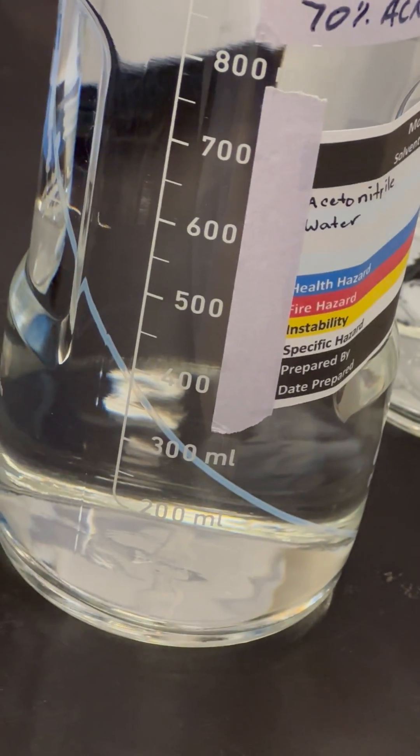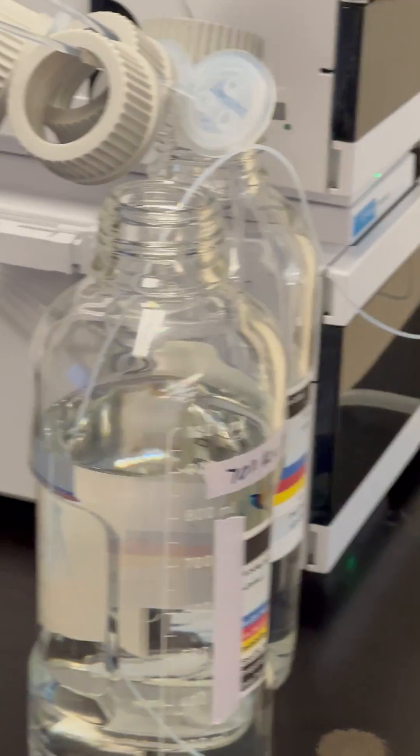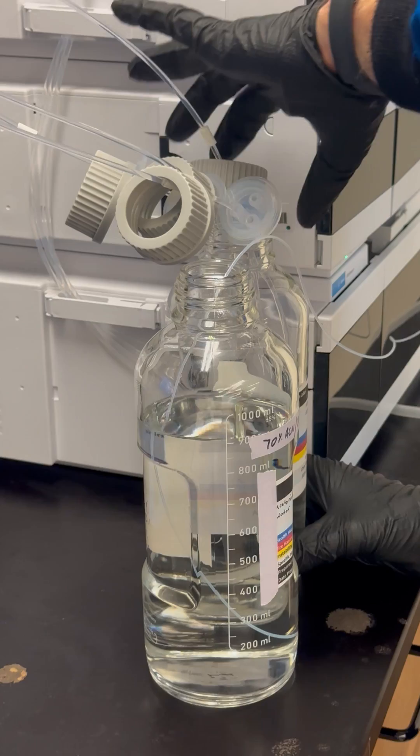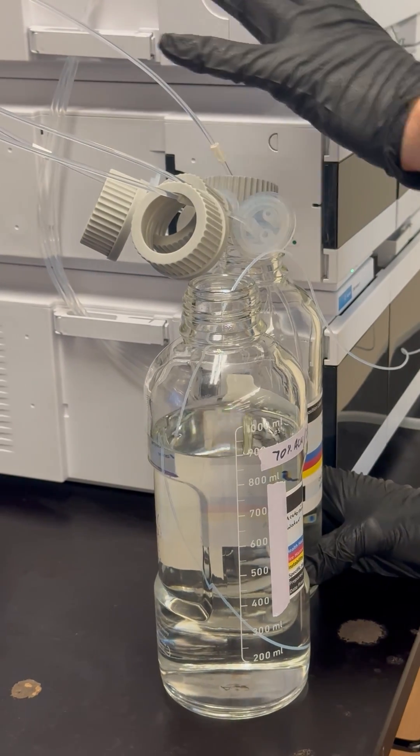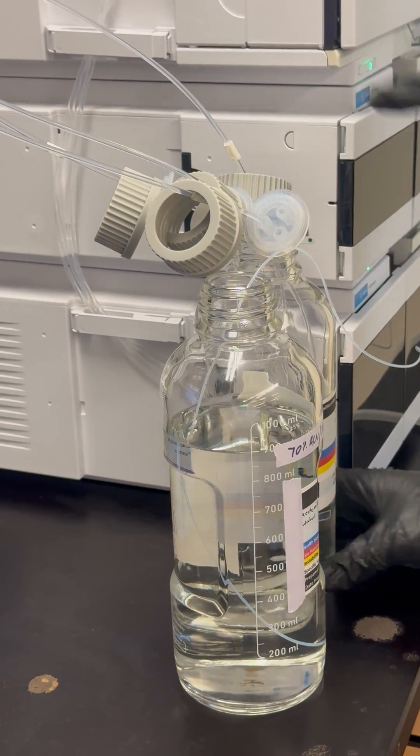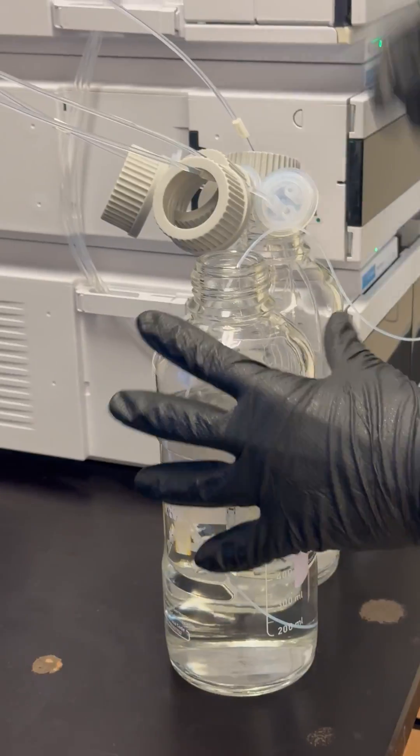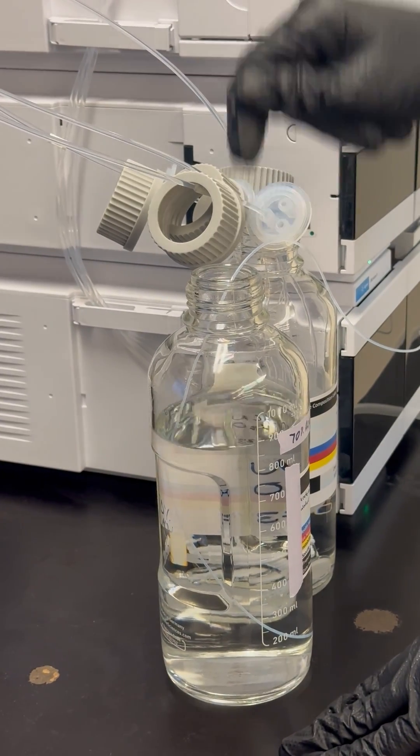In addition to that, we're going to one by one change our four lines. In between changing, if you were to move this with some different solution directly into this mobile phase bottle, every time you do that, you're introducing impurity.